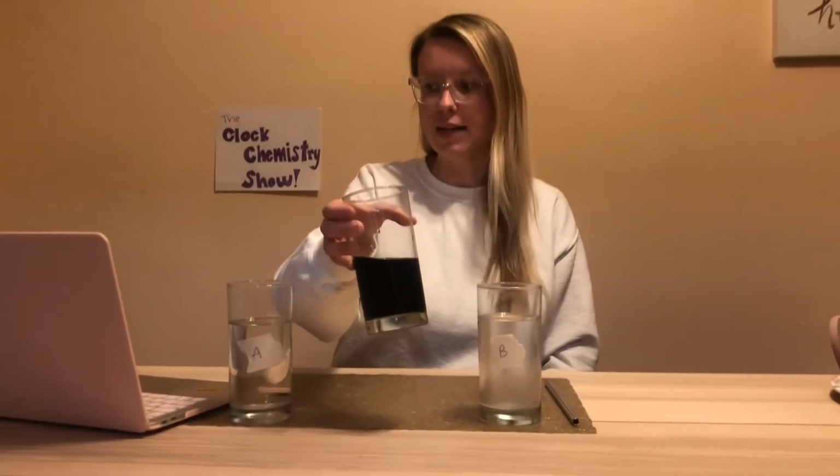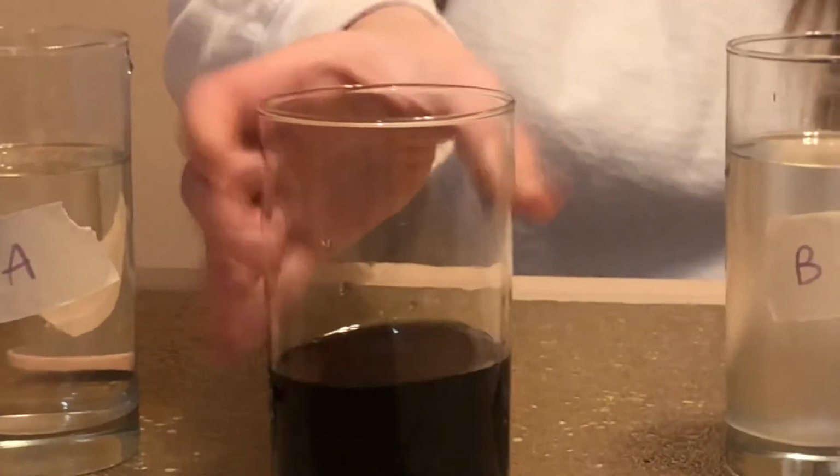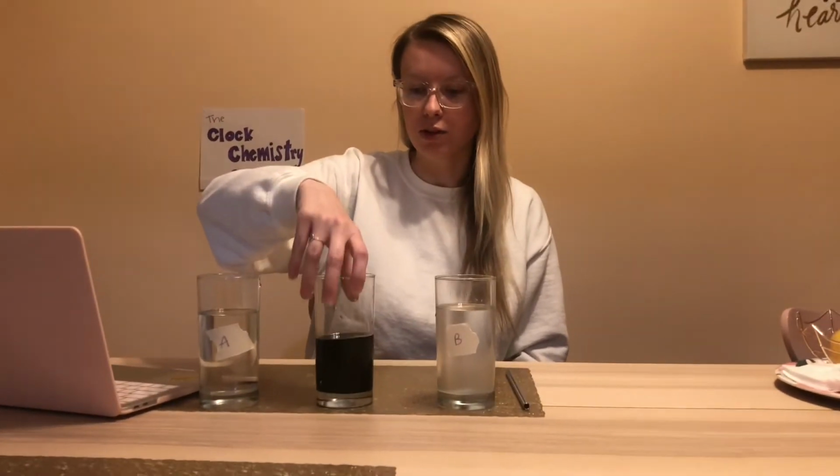And as you can see, the experiment worked as intended. All of these reactions went through. The hydrogen peroxide was able to get it back to the dark hue of the original iodine tincture. And now we have this wonderful solution of triiodide and cornstarch.